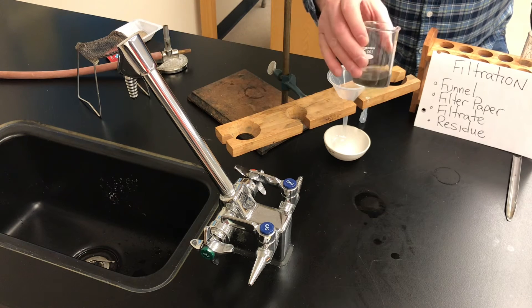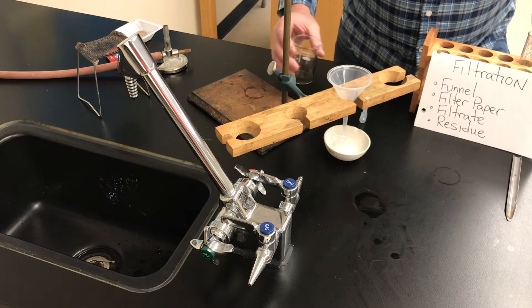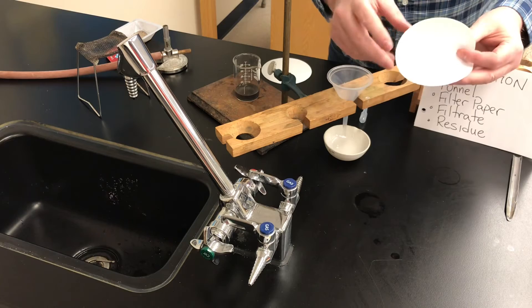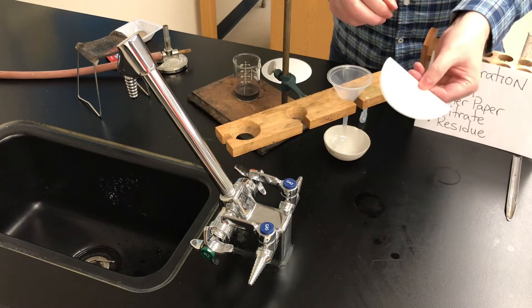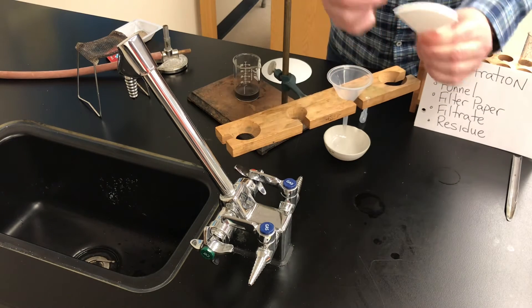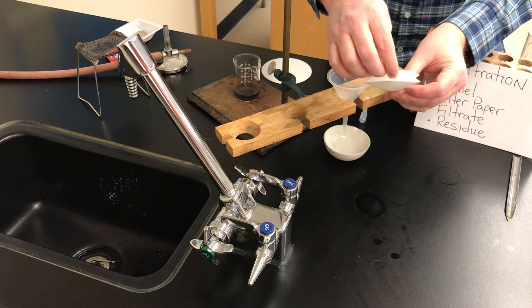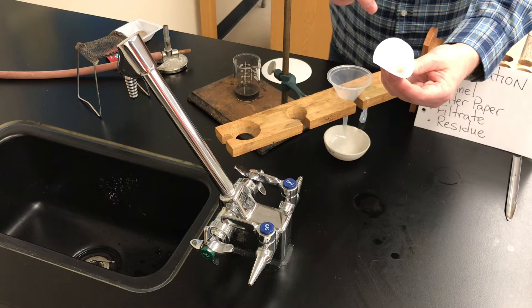If I just poured the liquid with the salt and charcoal straight into the funnel, it would all go through — the funnel wouldn't be doing anything. This is where the filter paper comes into play. I'm going to take the filter paper circle, fold it in half to make a semicircle, and then fold it in half once more to make a quarter circle. Then I'll grab three of those layers and pull them to one side, with one layer on the other side, to create a little cone.